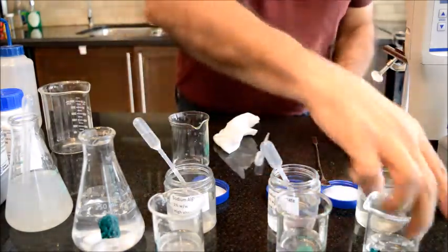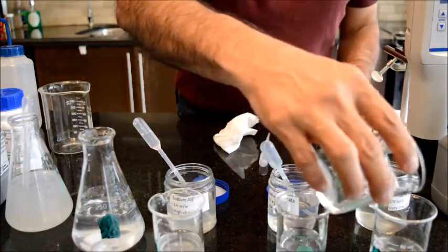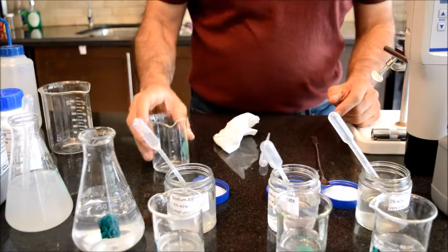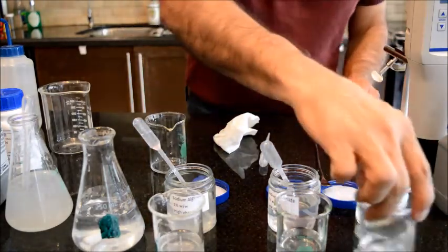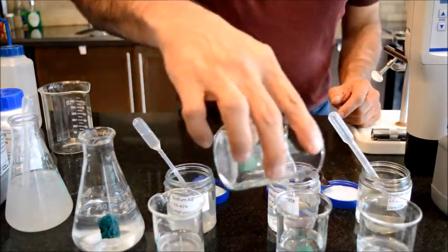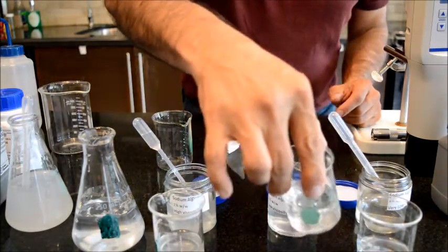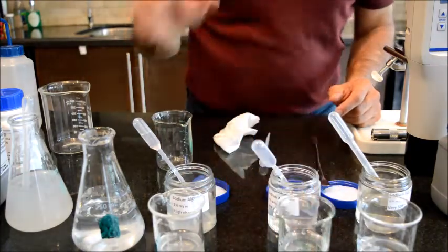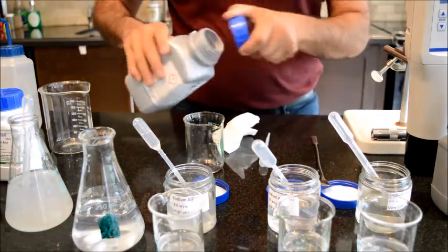First of all, as I said, this is very liquidy, and I'm going to add a little bit of calcium chloride here. You can see this is immediately forming a solid, and I'll do the same thing with the medium viscosity. Again, it does immediately form solid material, and we'll also run out of calcium chloride solution. I'm going to make a little bit more.